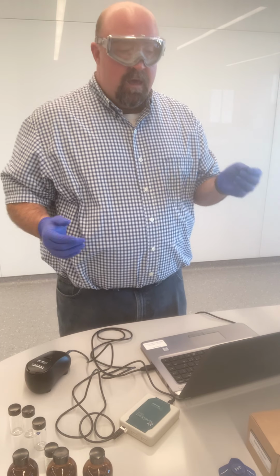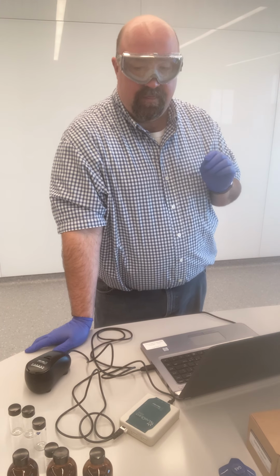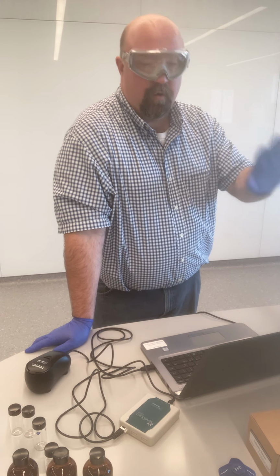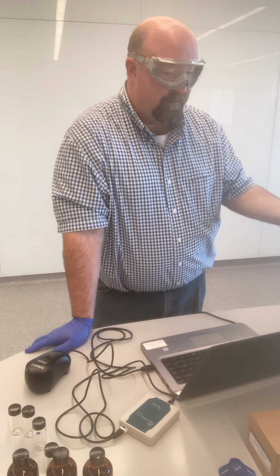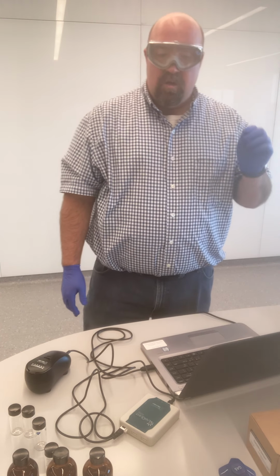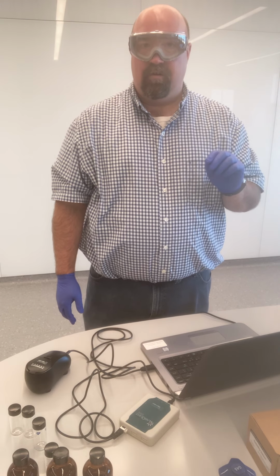And so I'm about to go through a number of different steps here in order to calibrate the turbidity sensor. What you would need to write in your notebooks is something to the effect of: the turbidity sensor was calibrated using 0 and 100 NTU standards.